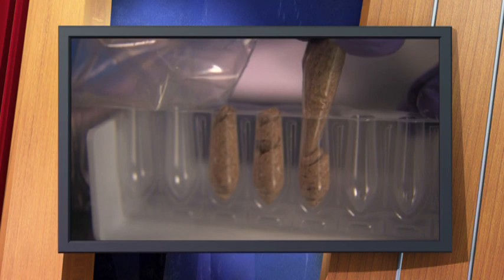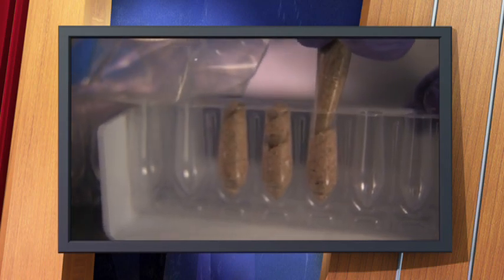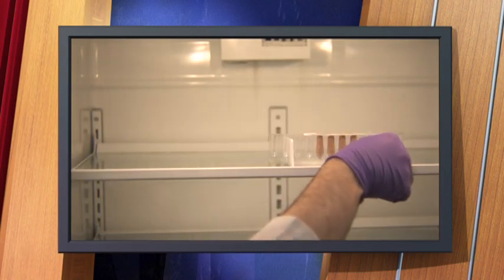Preparing suppositories involves melting the base and adding the medication. The mixture is then poured into a mold and chilled immediately, ensuring the suspended ingredients won't have time to settle. The suppository dosage form allows for complete absorption of the active ingredients and quick delivery of the medication.